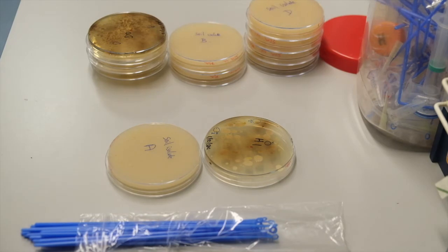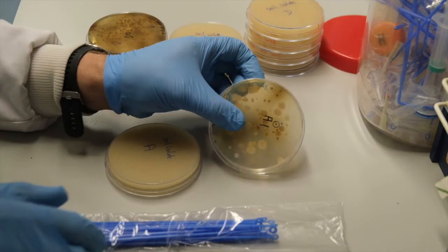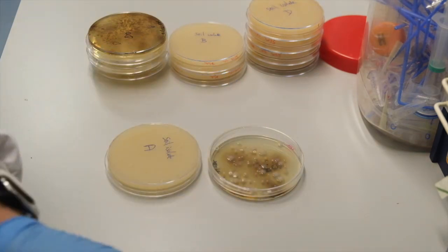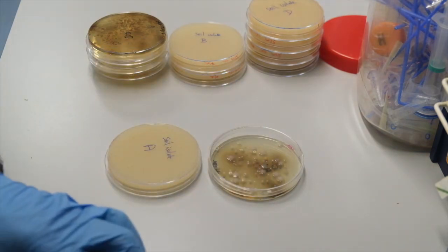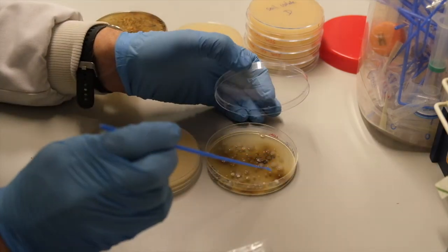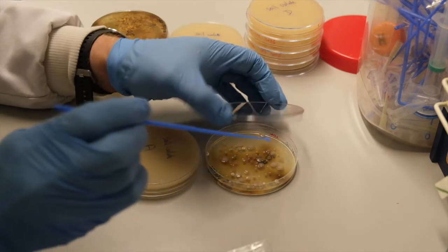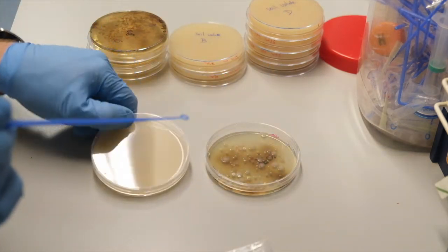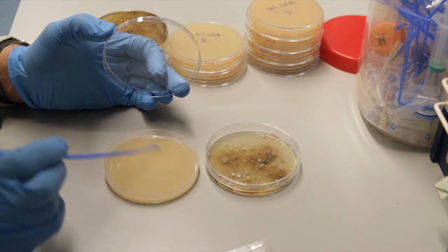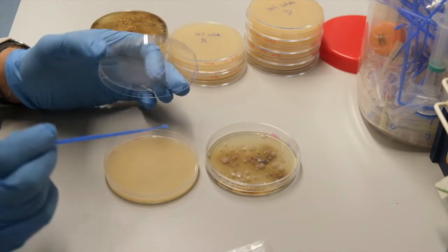Notice how the soya flour makes the soya flour mannitol plates cloudy compared to the original Gause number two media. Watch as I pick single colony A and streak on soya flour mannitol plates using three fresh sterile plastic loops. Most species of streptomyces grow and sporulate well on soya flour mannitol plates.